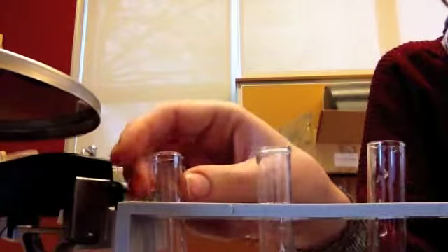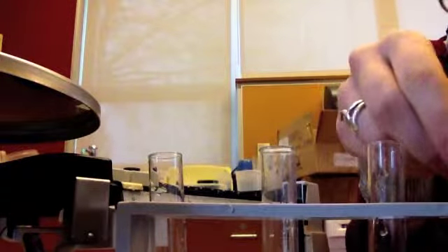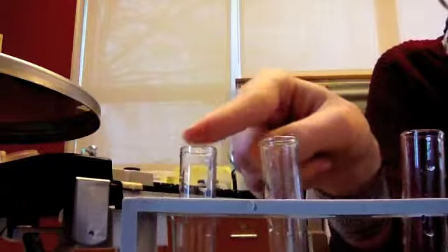Alrighty, so this is investigation 15, experimenting with the saturation point. We have several different experimental conditions. We're going to do a stir, shake, cool, and heat. We're going to be mixing sugar into each of these test tubes with those 4 different conditions of stir, shake, cool, and heat. And then we'll have one control where we won't be doing anything.